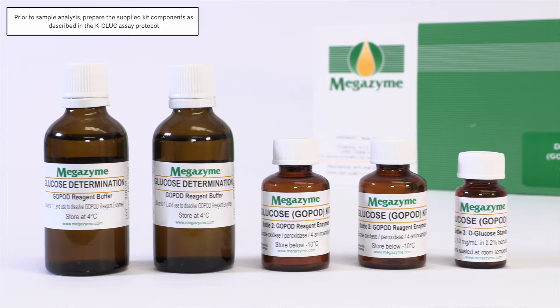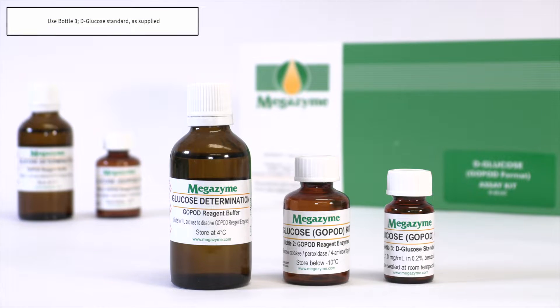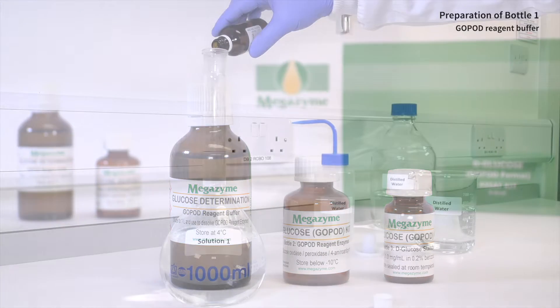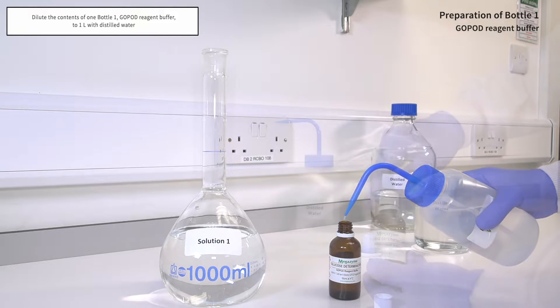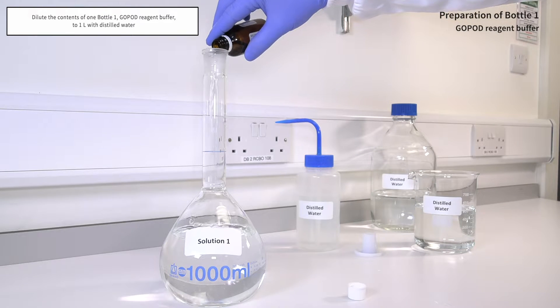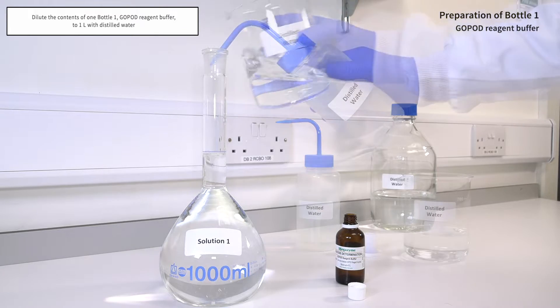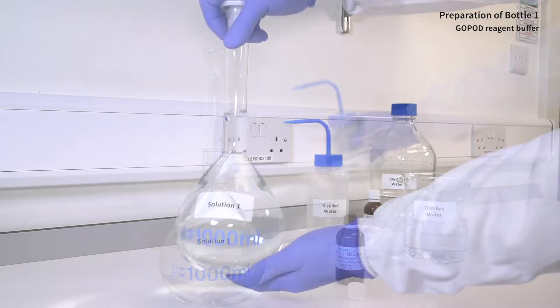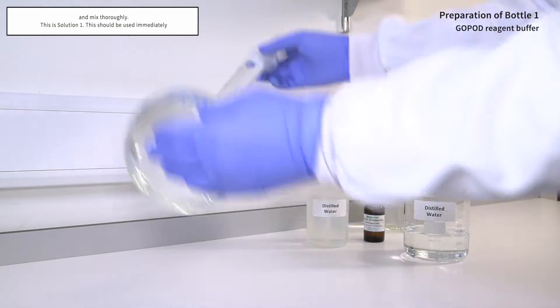Prior to sample analysis, the kit components should be prepared as described in the assay protocol and once prepared they are ready for use in the assay procedure. Use the contents of Bottle 3 as supplied. Dilute the contents of one Bottle 1 GOPOD reagent buffer to 1 litre with distilled water and mix thoroughly. This is Solution 1 and should be used immediately.